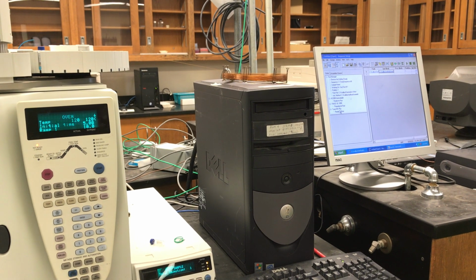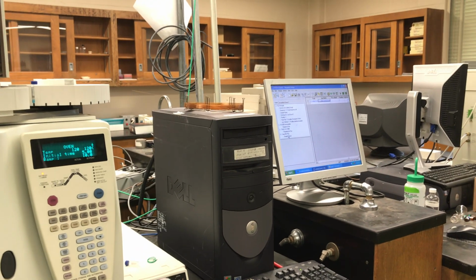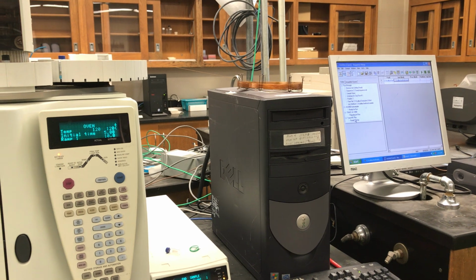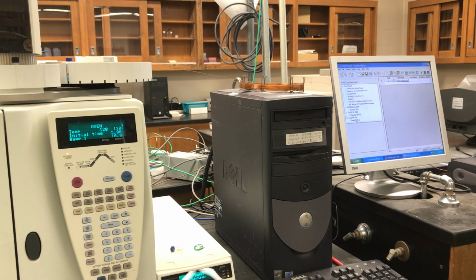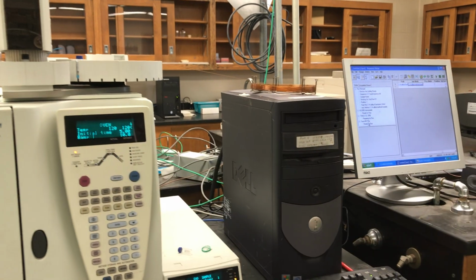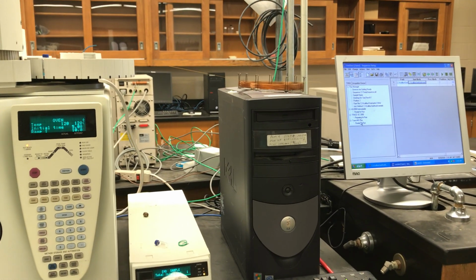Sometimes this may take a minute or two, so this is a good time to be patient. And we're being very patient. I can either watch the status of the GC here on the panel, or over here in the status panel.